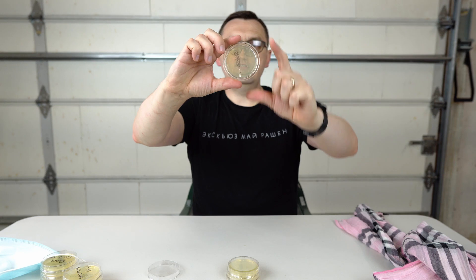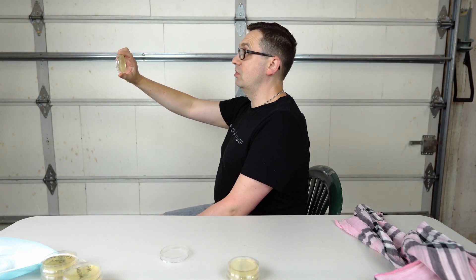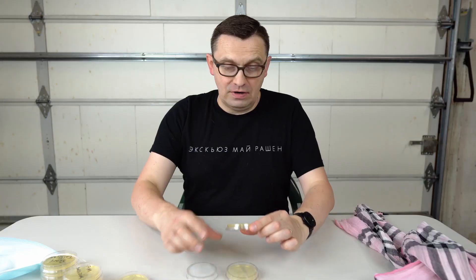This time I'm going to do all these things but without any mask or scarf. I'm going to start talking towards this petri dish, the same distance — about one foot away. We're going to see if there is going to be any bacterial growth or not. I'm assuming it's going to be a lot of bacteria growth on this petri dish. Now coughing and sneezing.